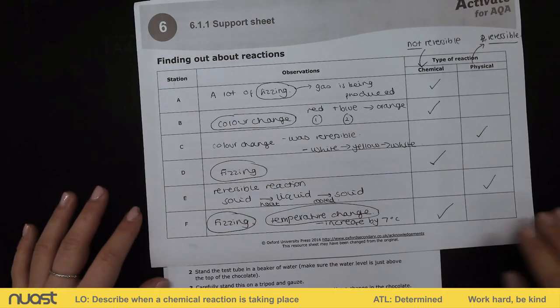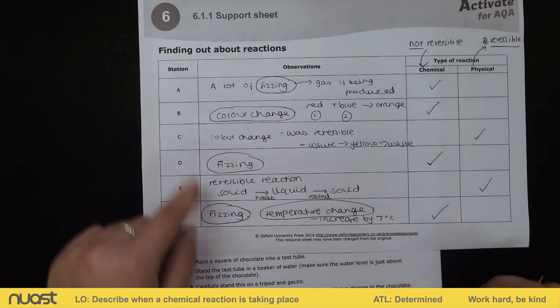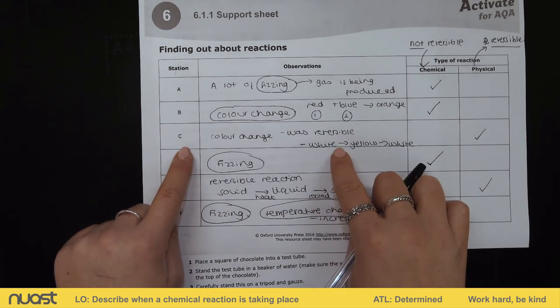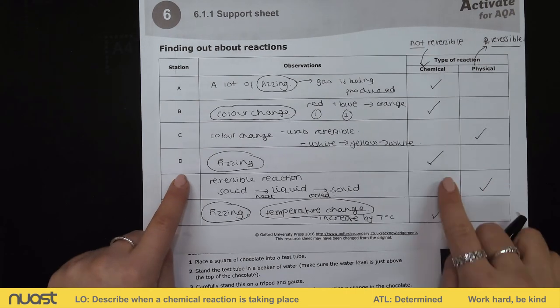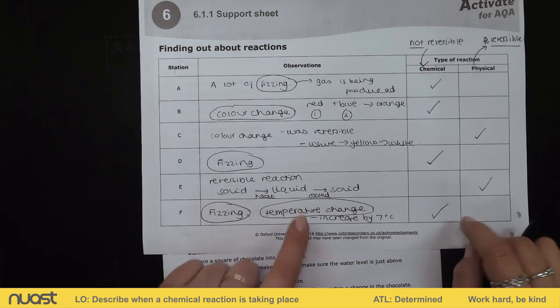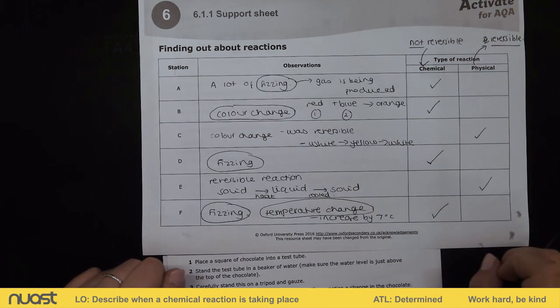If you need to pause the video and fill in your table, feel free. To summarise: station A, we saw fizzing, showing a chemical change. Station B, we saw a colour change, showing a chemical change. C, it was reversible — changed colour then returned to the original colour — showing a physical change. D, we saw fizzing, so a chemical change. E showed a reversible reaction going from solid to liquid to solid, so that was physical. And F, we saw fizzing and a temperature change, showing a chemical reaction.